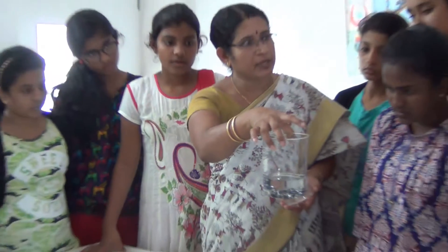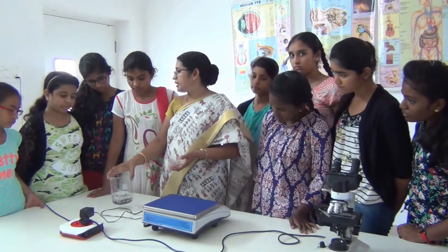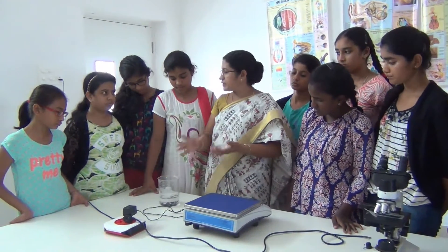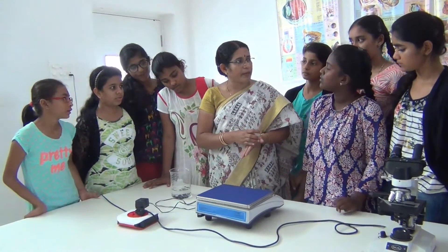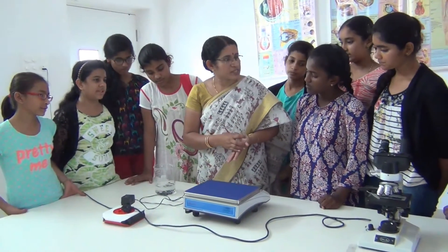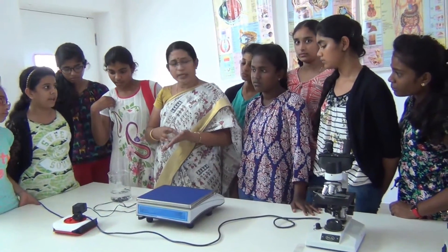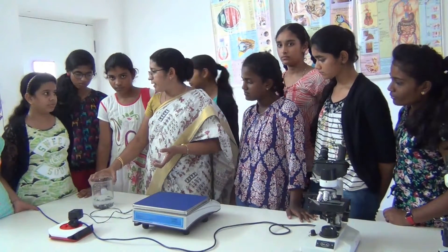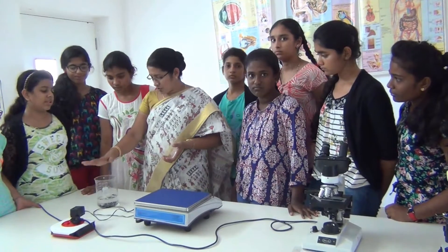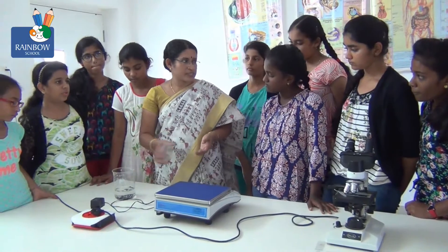Then after 5 to 6 hours, we will observe and take the weight again and see the difference. The difference in weight will let us calculate the percentage of water imbibed by dry raisins. The formula is: W2 minus W1 by W1 into 100. That is the percentage of water imbibed. So after 5 to 6 hours, we will observe the raisins.